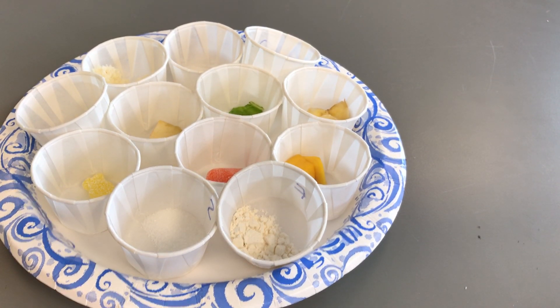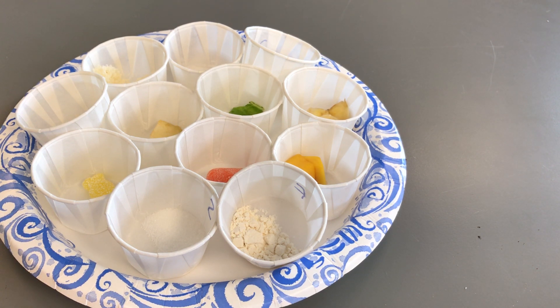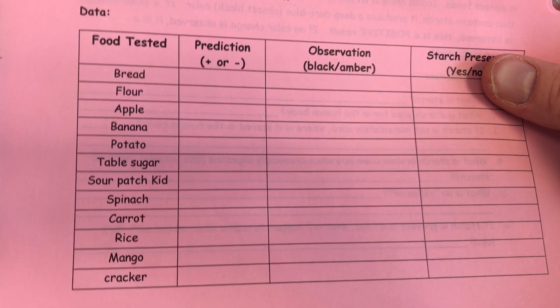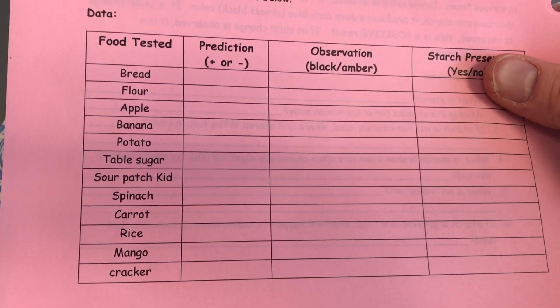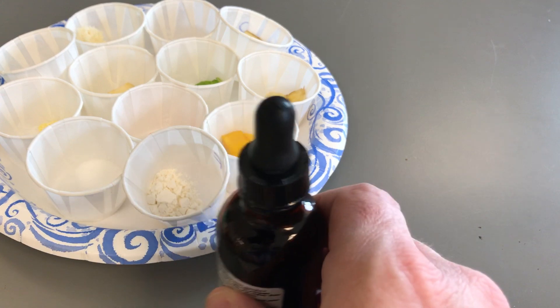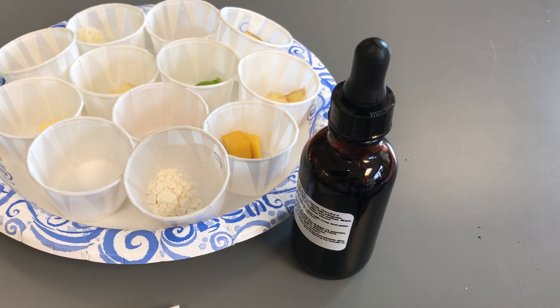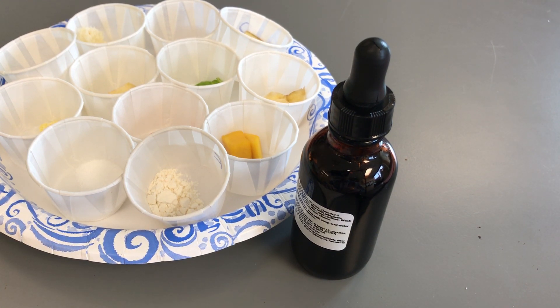In today's lab we did a complex carb investigation on starch. After you've read the introduction, answered your pre-lab questions, and filled in the predictions column — yes or no, positive or negative, whether those materials have starch — you're going to watch this video to see the results when reacted with iodine. Iodine is used as an antiseptic; for example, before surgery they rub it on your skin to destroy microscopic organisms and bacteria. It's in the same group on the periodic table as chlorine and fluorine, which have similar antibacterial properties.